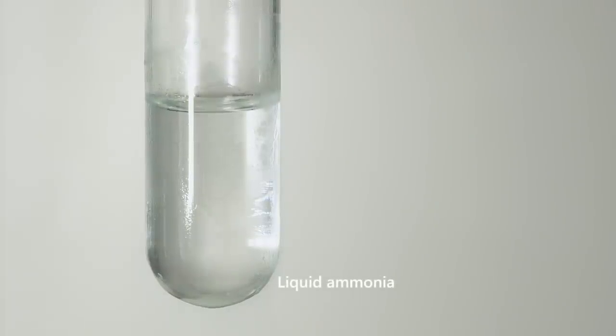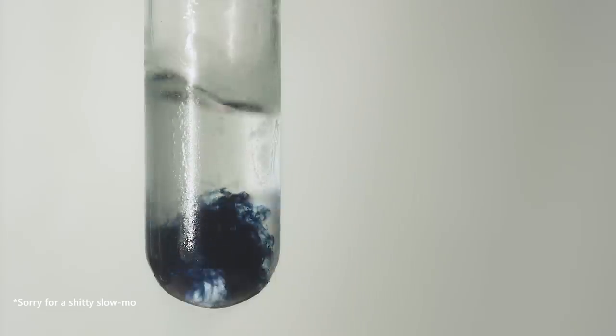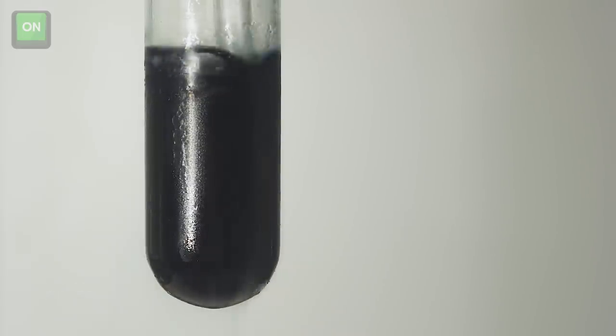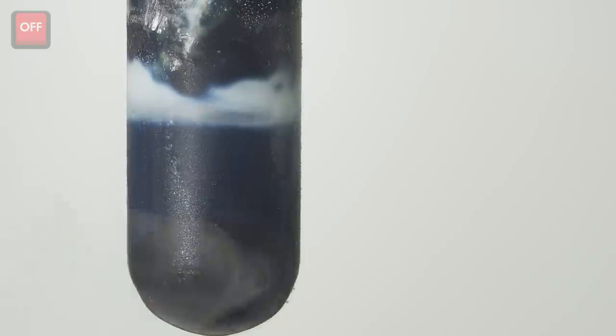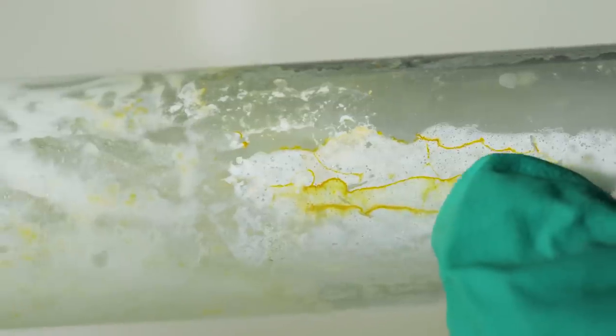Also, potassium ozonide forms when ozone is passed through a solution of potassium dissolved in liquid ammonia. As well as other alkali metals, potassium is soluble in liquid ammonia. This dissolving results in a dark blue color and the forming of potassium amide, which makes the blue color turn white very quickly. Potassium ozonide formed during the reaction may be seen as orange-red inclusions on the tube walls in the white potassium amide.